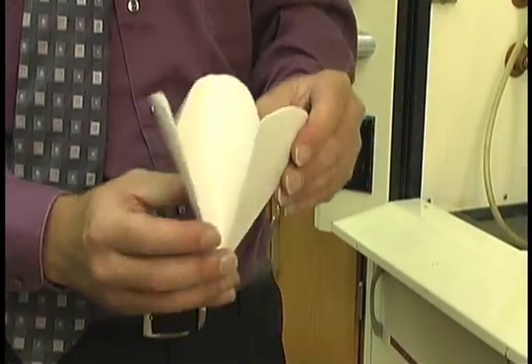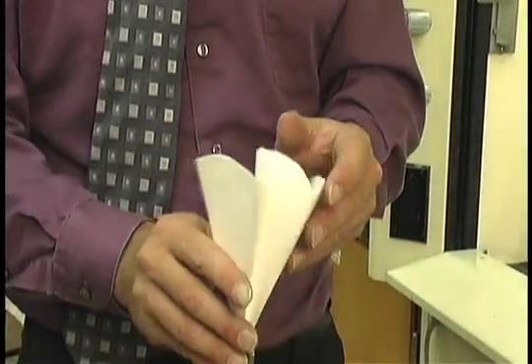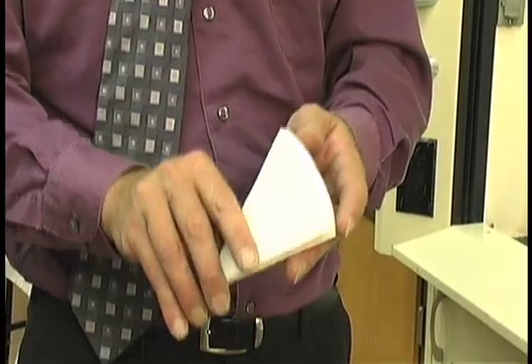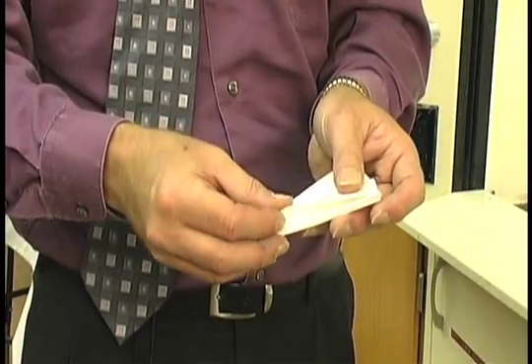Upon opening, you should then have a fan. Fold it again back to the cone. Take the edge, outside edge, and fold it to the inside.